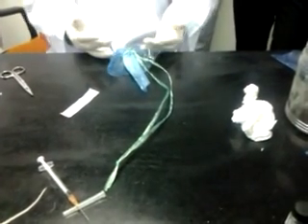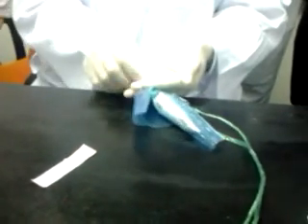Now, because the mouse tails are very short, not like a rat's, which are longer, the space for it, you see, two inches from the tip of the tail is very short. And when we want to work with it, because it's too short, we have to use the edge of the table. Pull down, tourniquet the vein. This is the left side. This is the vein. Okay, we squeeze the vein, using an alcohol swab. Apply, so everything is around.